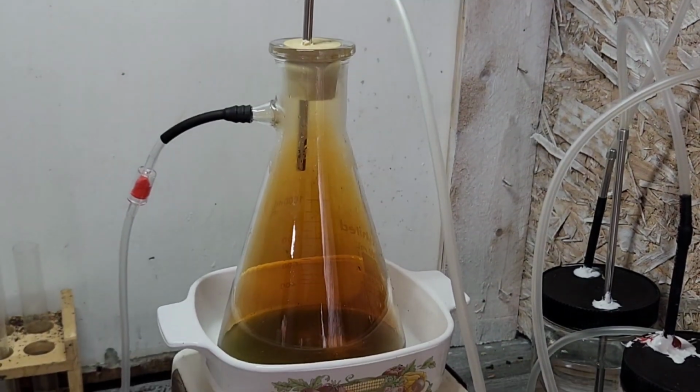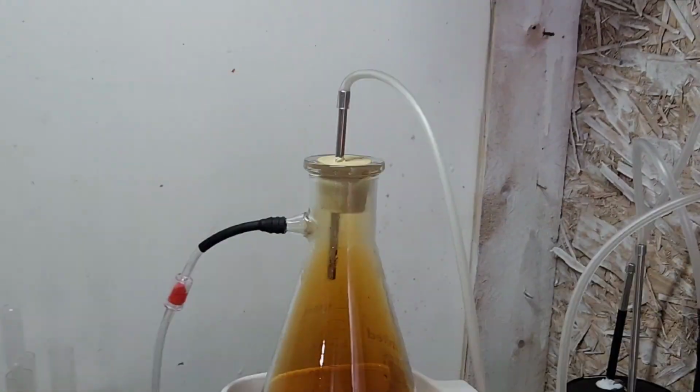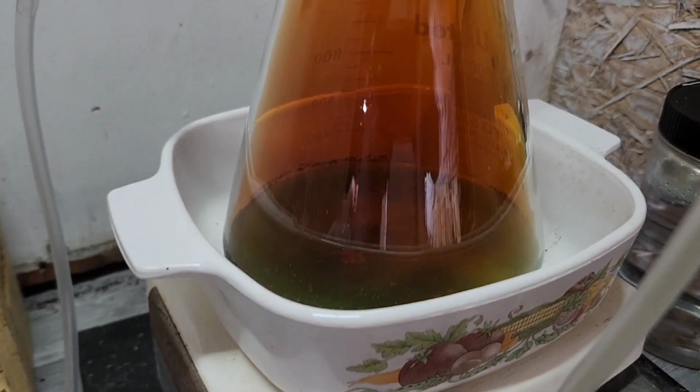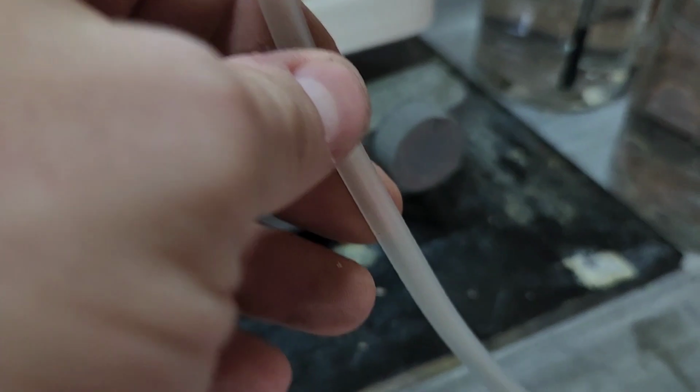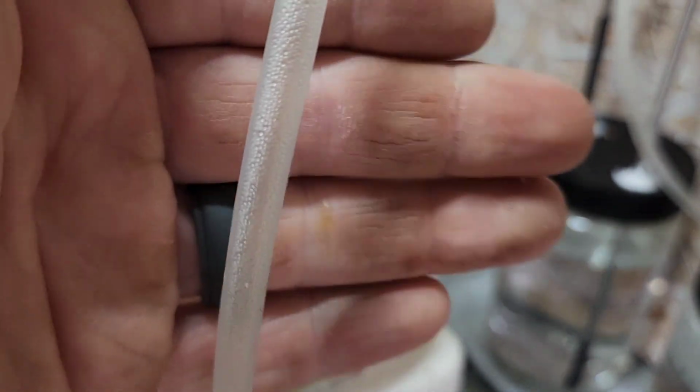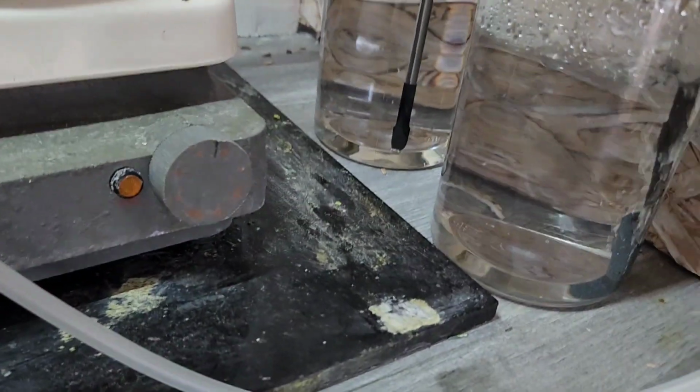Let's see here. So it is definitely, you can see that slight hue color of the orange. So we are getting some in there. We're heavily packed with fumes here. We don't have anything going back this way, which is perfect, thanks to that check valve. We can see we've got some condensation coming up here, so we know that we've got actual pressure going through the tube here. So it's going in the right direction. So that's good.